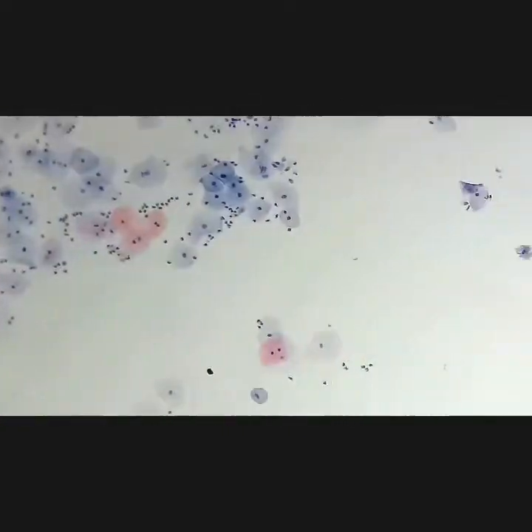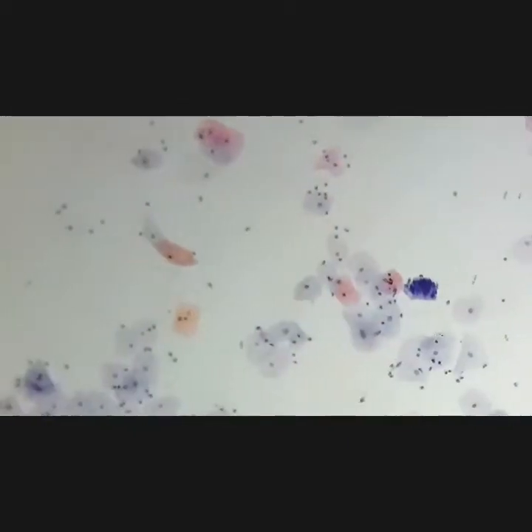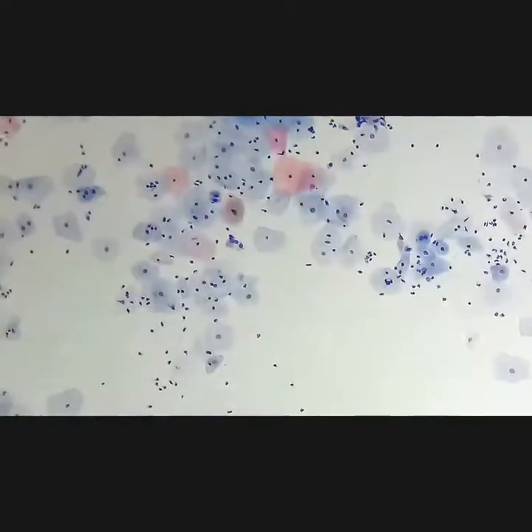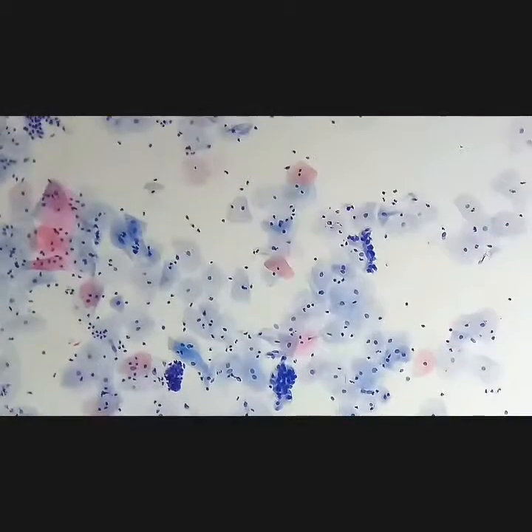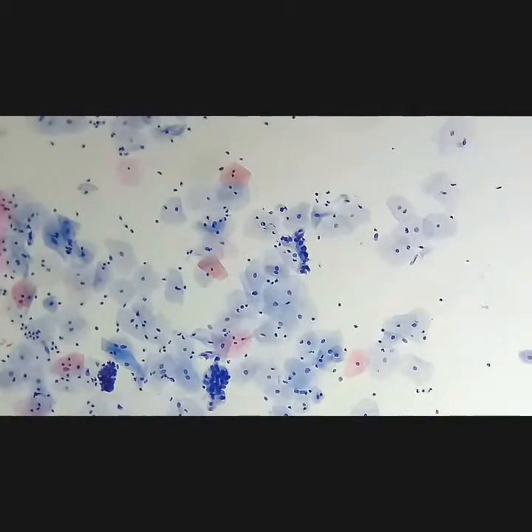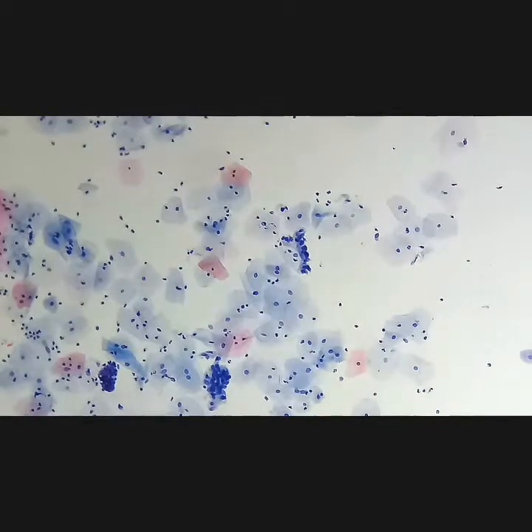This is what I call the Indian hat pattern — as one can remember those Asian films with native Indians, the hats they have above their head. It's a very unique pattern for normal endocervical cells, and it's very important to recognize it because we also have this pattern in endocervical adenocarcinoma.